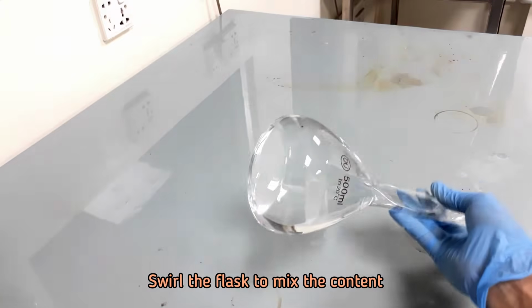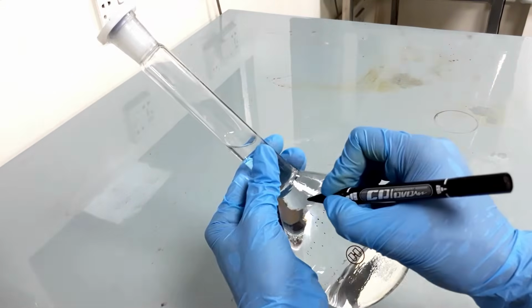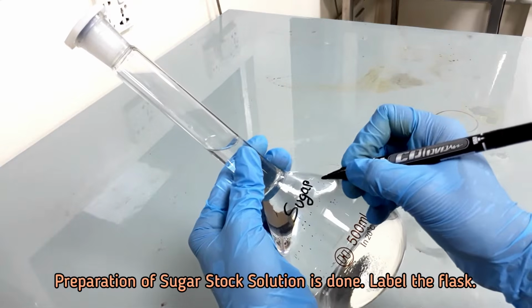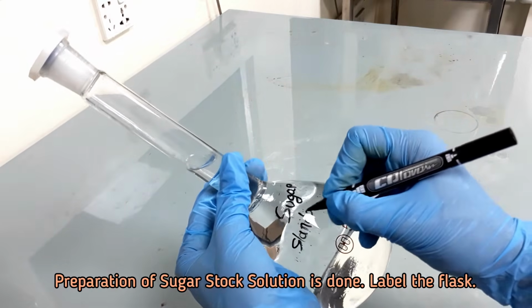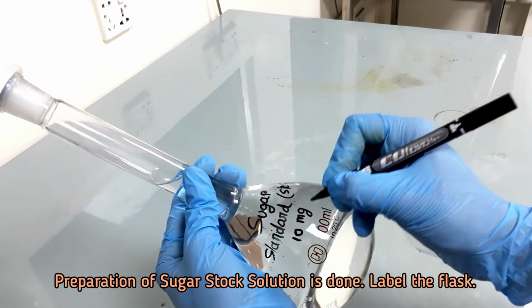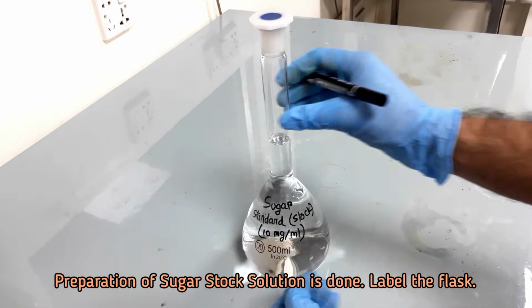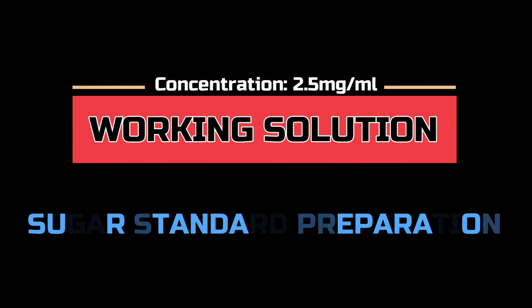Swirl the flask to mix the content and label it. The concentration of this stock sugar solution is 10 mg per ml. Now we will prepare working standard using the stock solution.